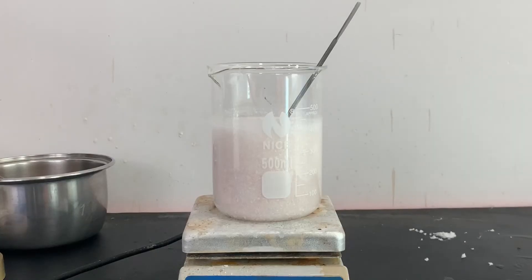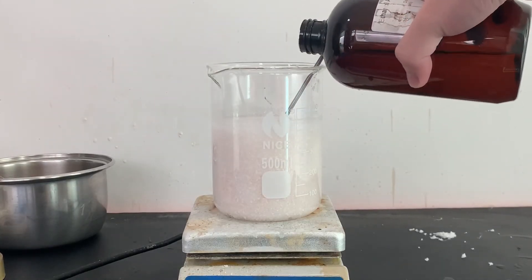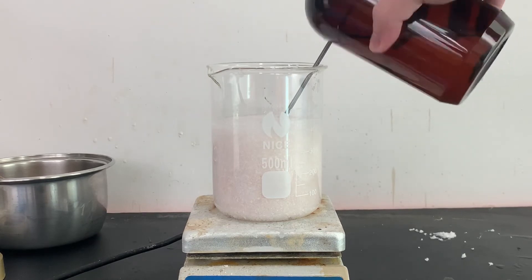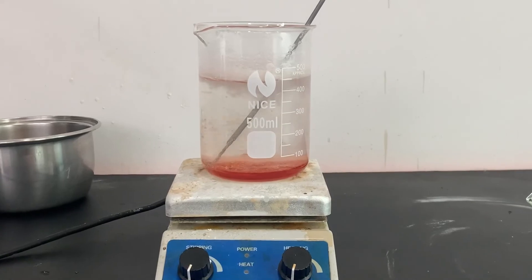I did this by pouring 200 ml of water to the beaker and also added some ethanol. I then heated the solution until it becomes clear.